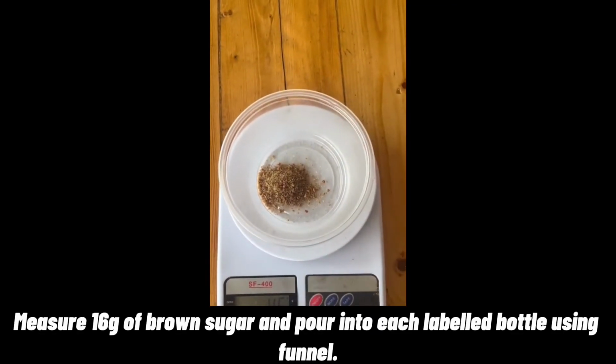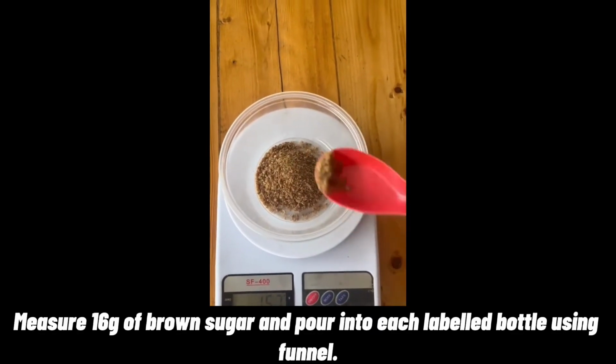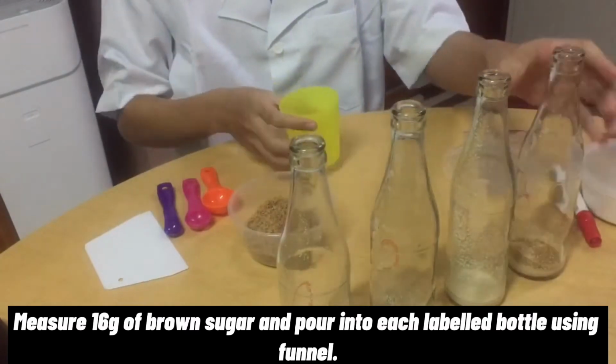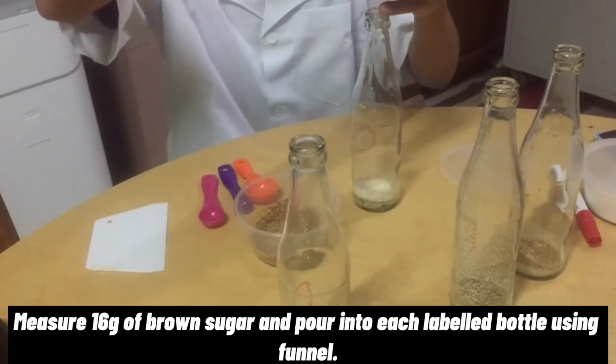Then, measure 16 grams of brown sugar that we already set as our constant variable too and put the measured brown sugar into each of our labeled bottles by using the funnel.